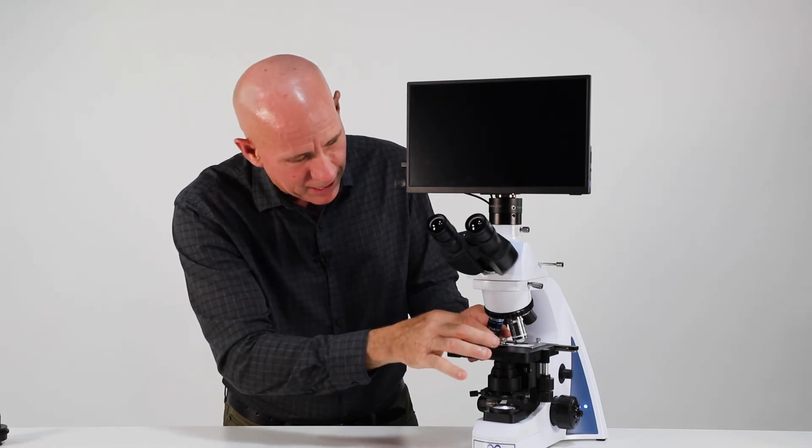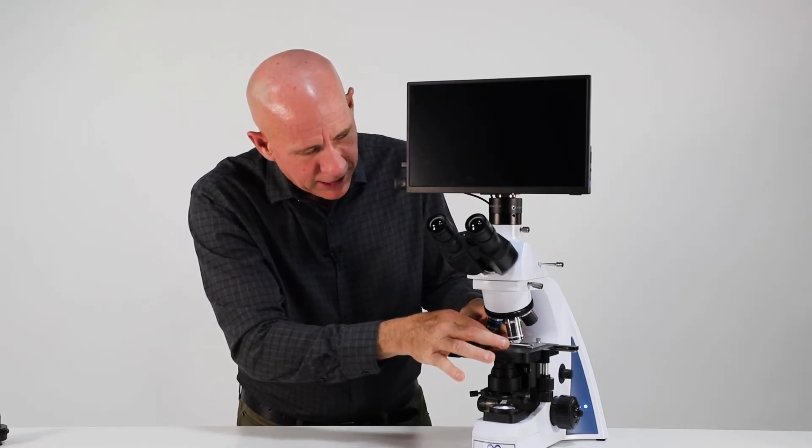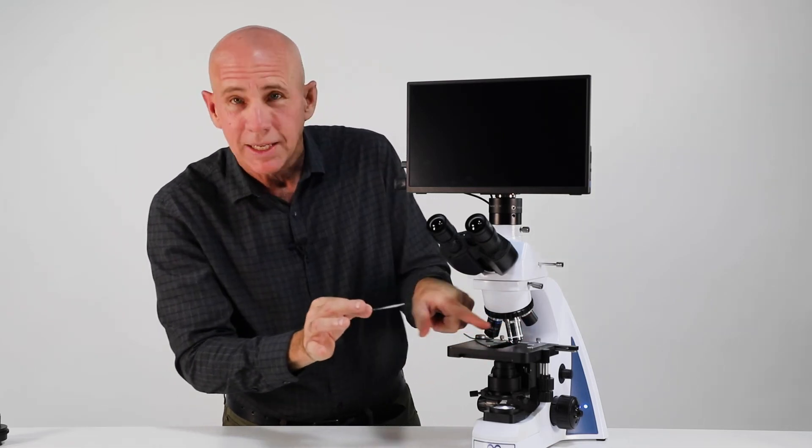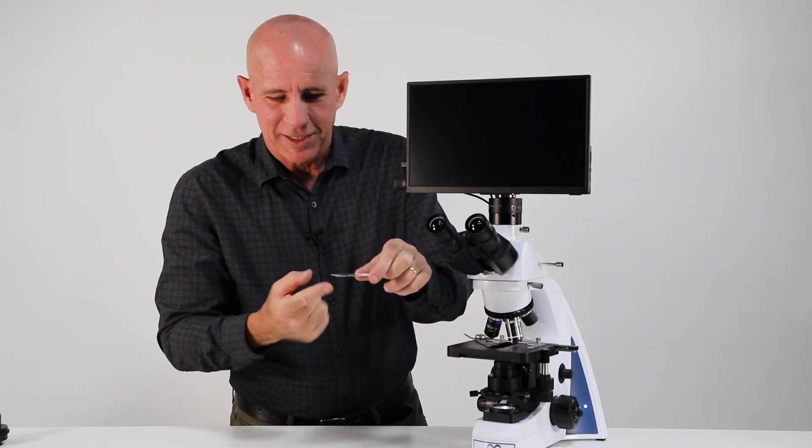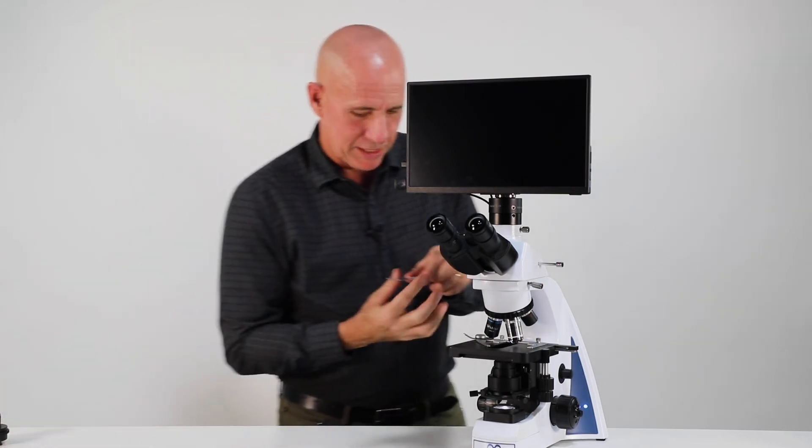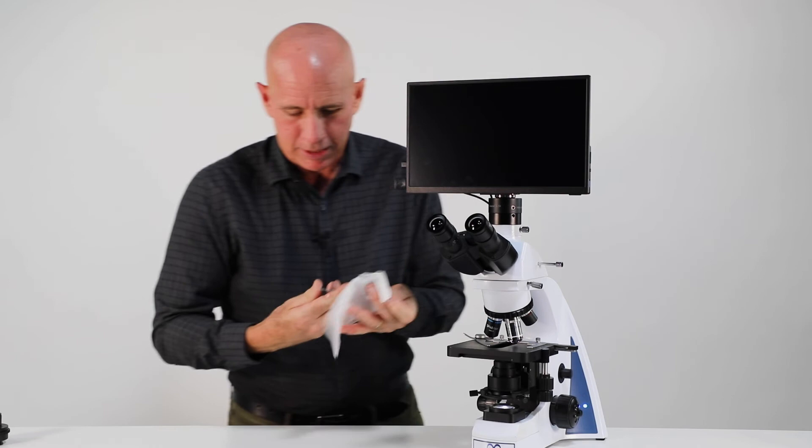So I'm going to take my slide off carefully, lifting it straight up. And I didn't get any oil on my slide. And if I set this down again, remember oils on the bottom oil is on the top. So I'm going to take my lens paper and clean this off.